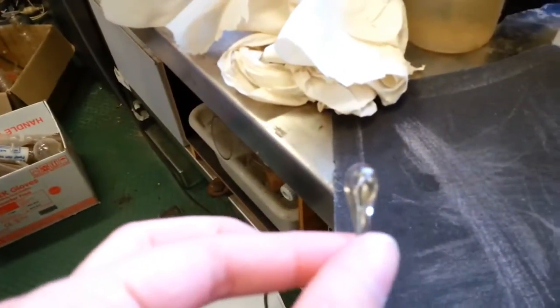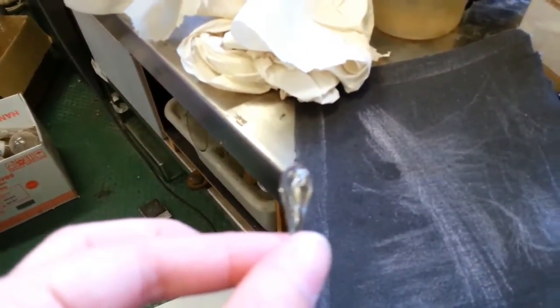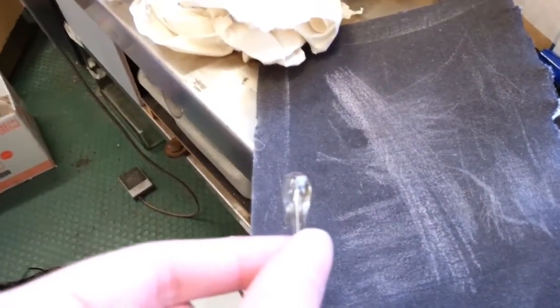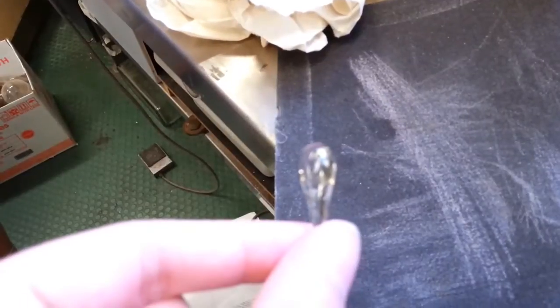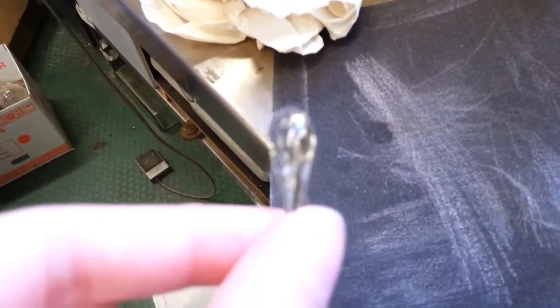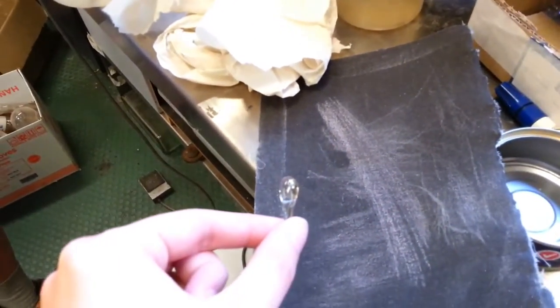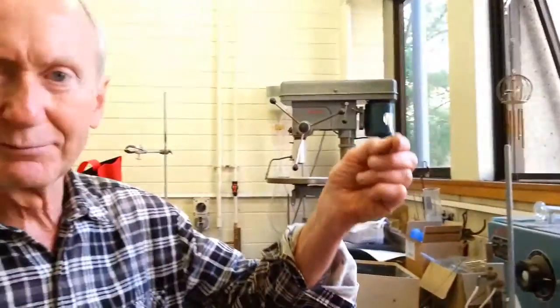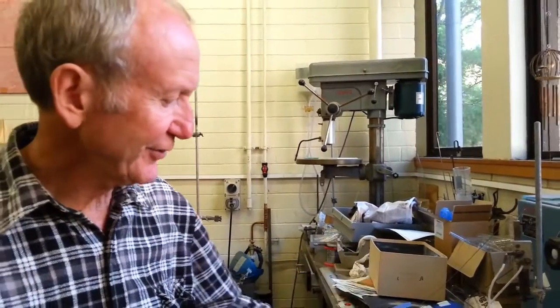I'll put my camera between the bulb and my face. Can you get the bubble there? Not quite, because the camera doesn't focus really well. It's not a very good camera. If I put it further away, that's okay. Anyway, there's a bubble there and the bubble is vacuum. Perfect vacuum because what's happened is it's ran out of volume.